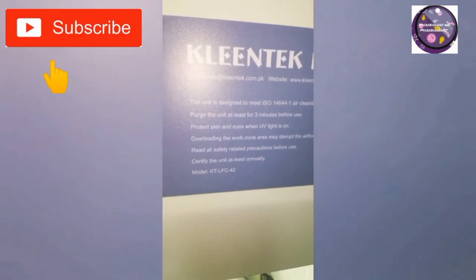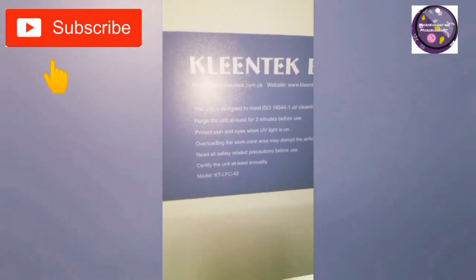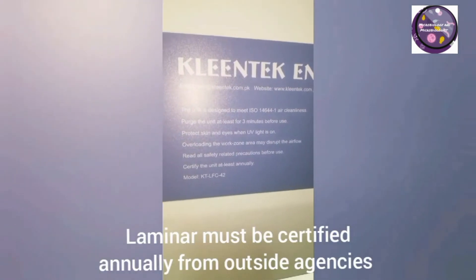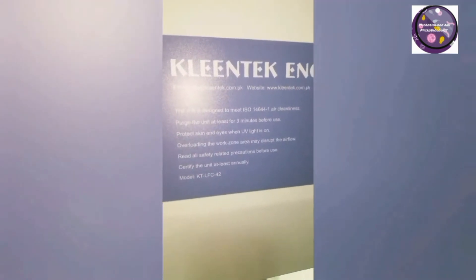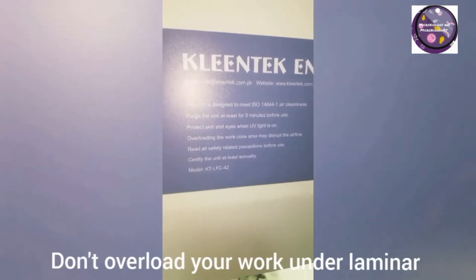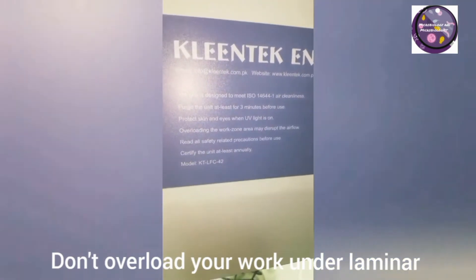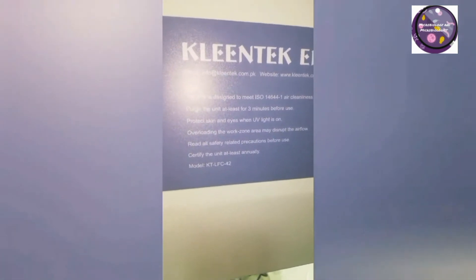It is written on the laminar airflow chamber that this unit is designed to meet ISO 14644-1 air cleanliness. Another note is to run the unit for 3 minutes before use. Overloading work is not recommended for this laminar airflow hood. It must be certified annually. Its model number is KTLFC 42.